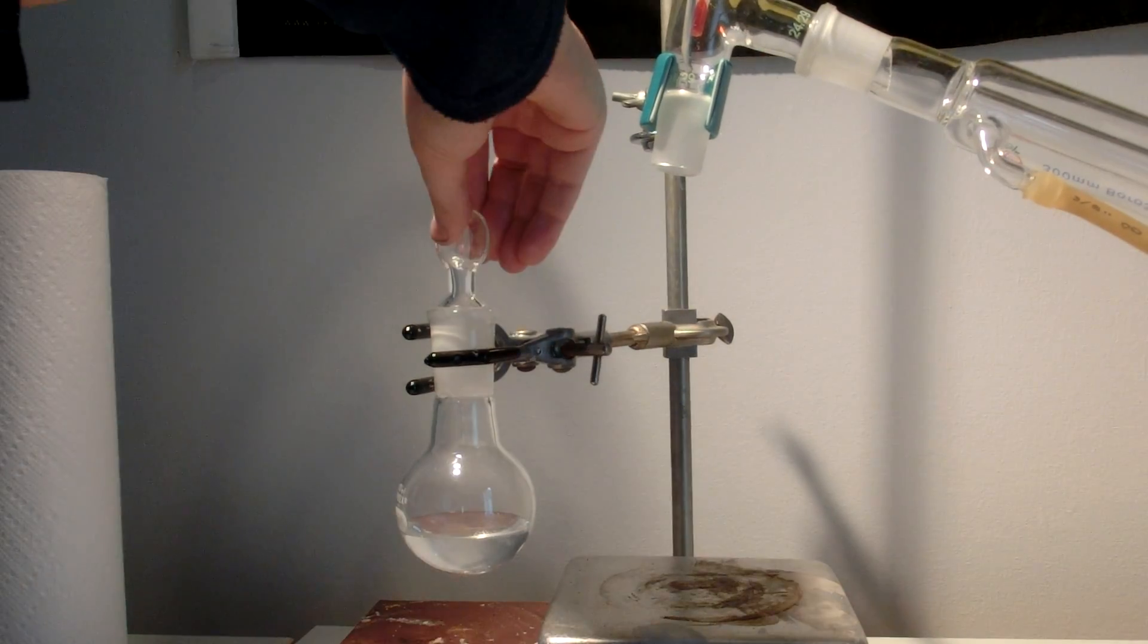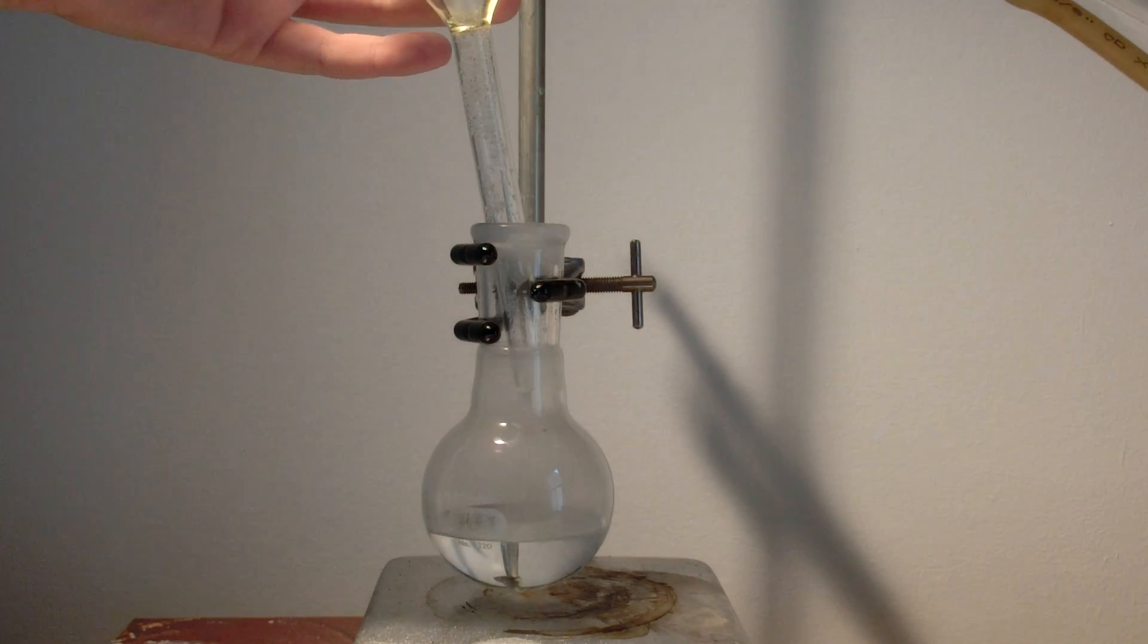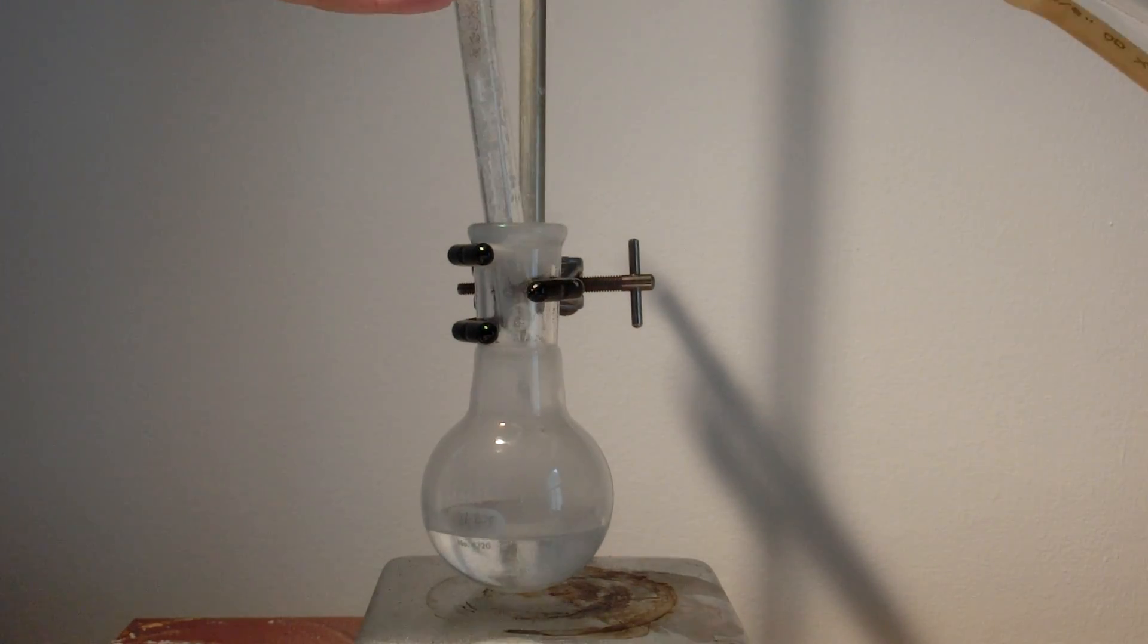Then a stopper should be added. The stopper should be removed, then 24 grams of oxalic acid dihydrate should be added.